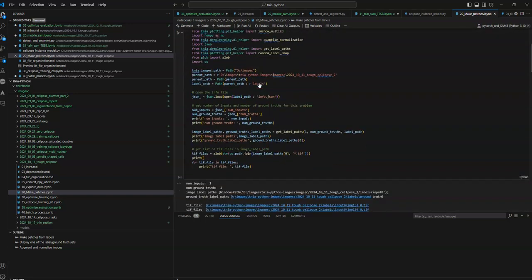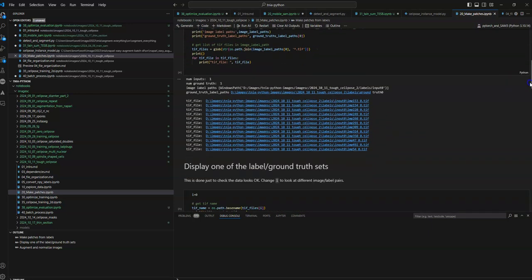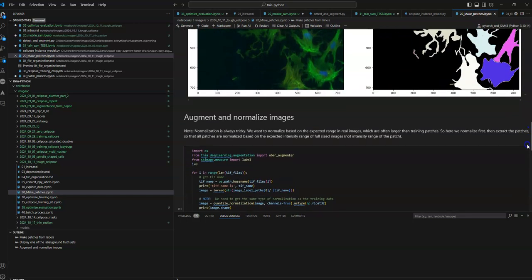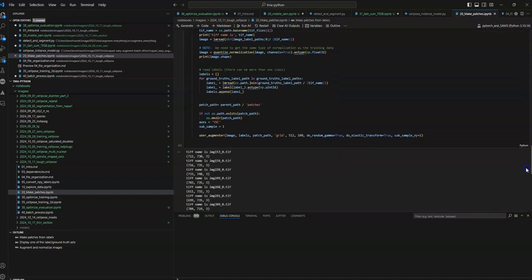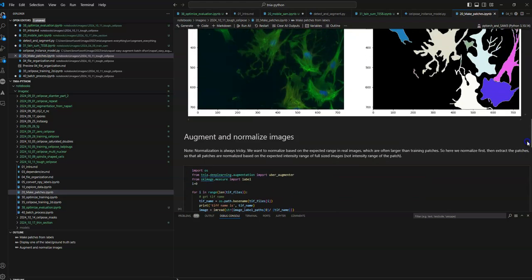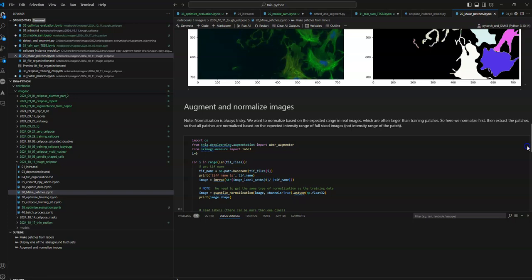loads in the labels, with a bit of glue code to find the labels in the right spot and just make sure they're looking okay. Then it normalizes the image and augments the labels to create these patches. Normalization is actually a tricky thing. When we do this stuff, we have to make sure that we normalize on both ends, the training end and the prediction end, if not exactly the same way, at least not in a completely different way.